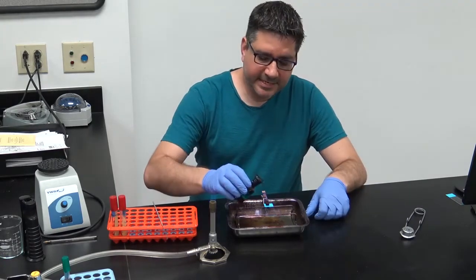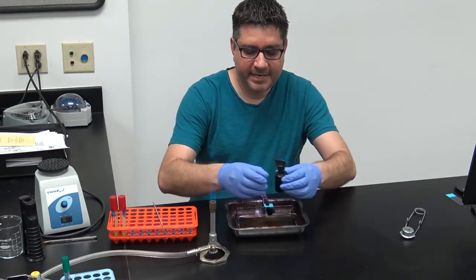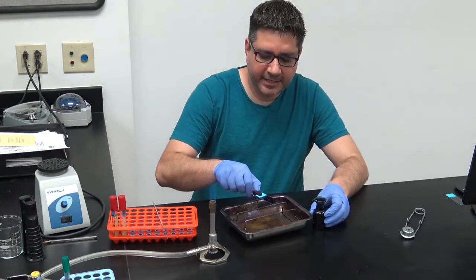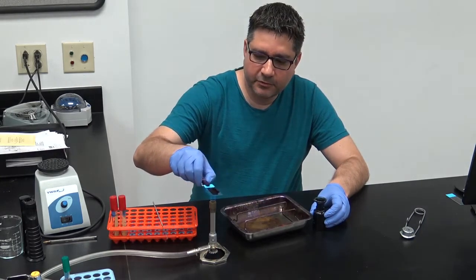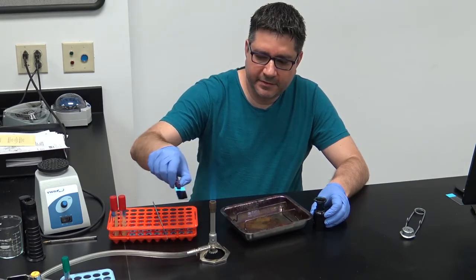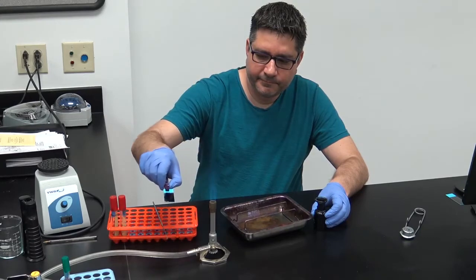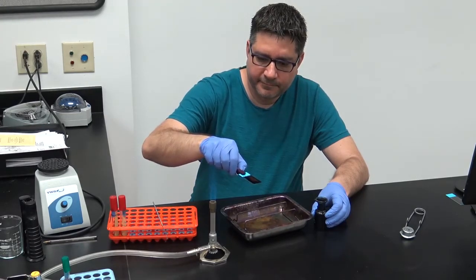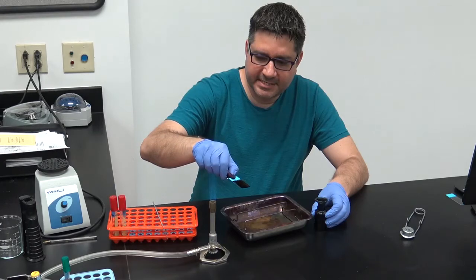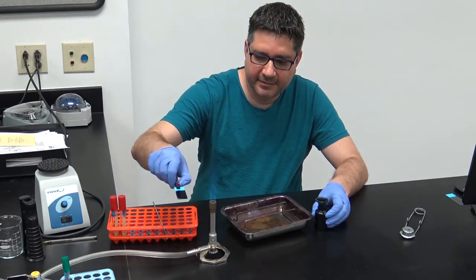To conduct the steaming technique, simply place the stain on your specimen. Next, take your slide carefully to the flame and slowly pass it through the flame. Continue to do this until you begin to see steam coming off the slide. Once the steam has stopped, continue passing it through the flame until it begins again.